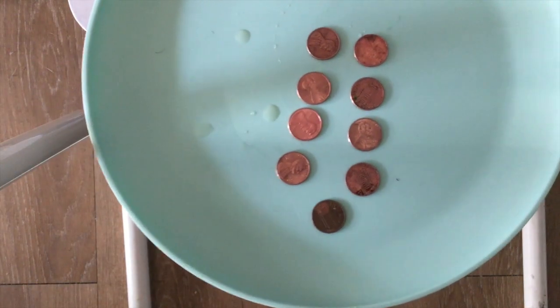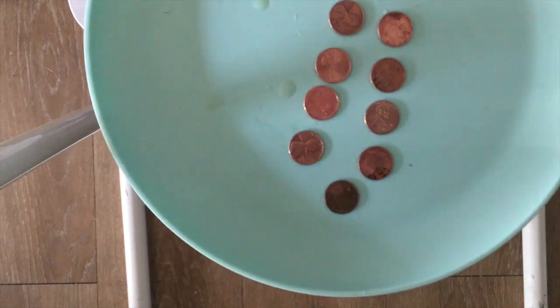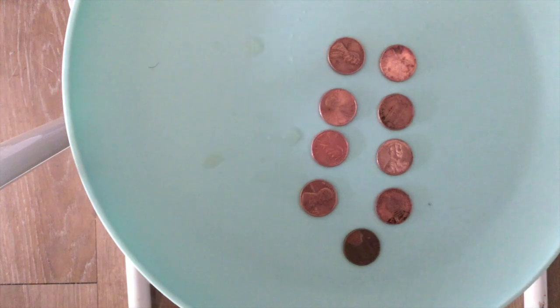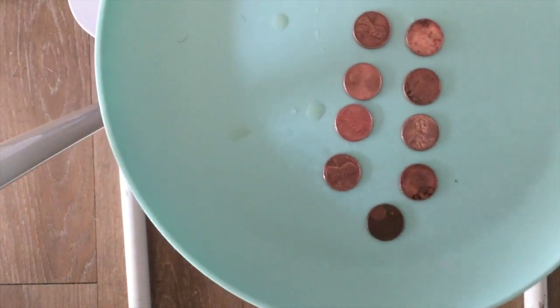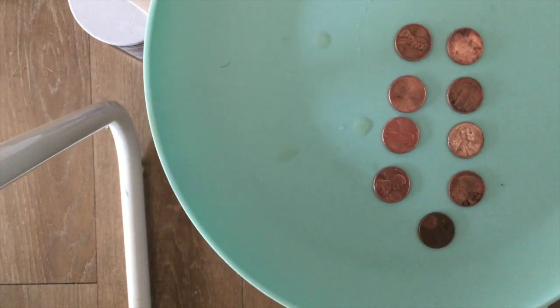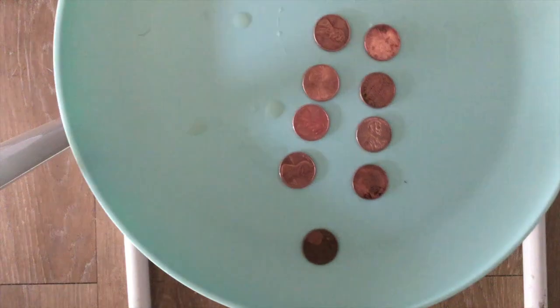As you can see, our experiment has concluded after I left them in for 15 minutes, and you can tell already that the NaCl and the vinegar have almost completely, not fully, pulled off the copper oxide that had oxidized on, and this is happening due to an acidic solution that has sped up the process. And this is our old penny over here that was not put in the solution.